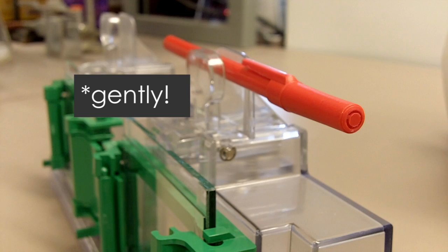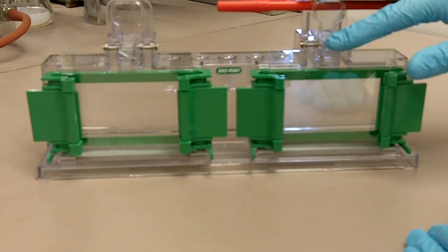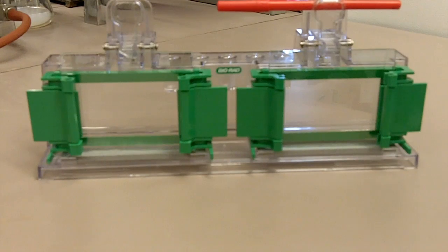What this does is the pen will increase the pressure that's generated from the clamp down here. So the plates will actually be clamped down tighter. And therefore the seal on the bottom would be better.